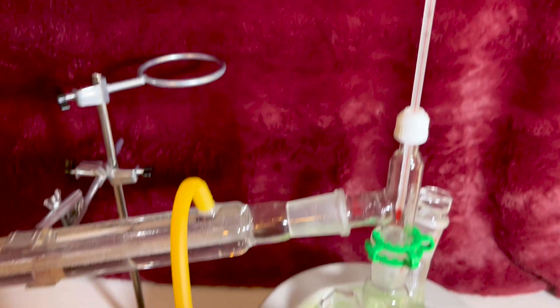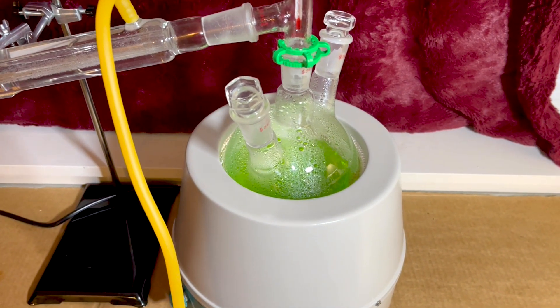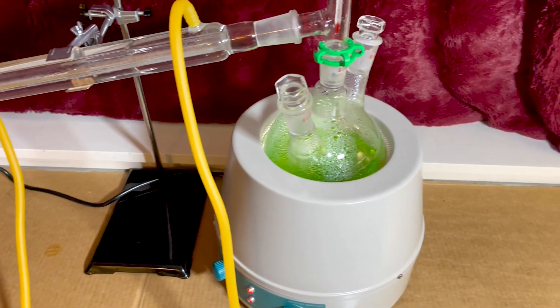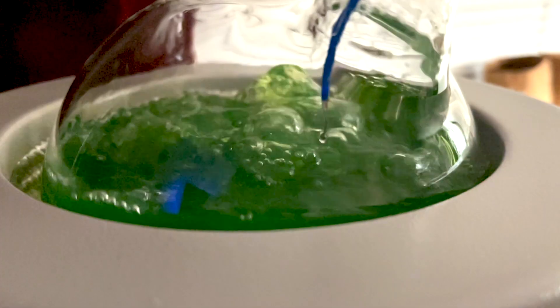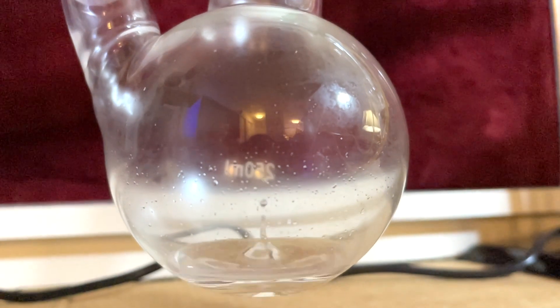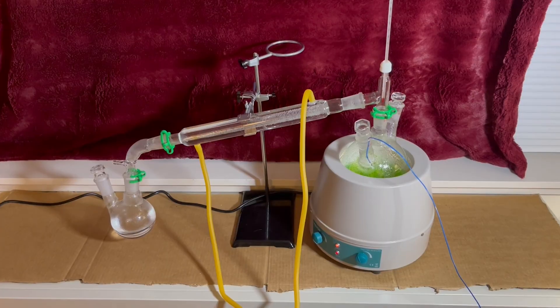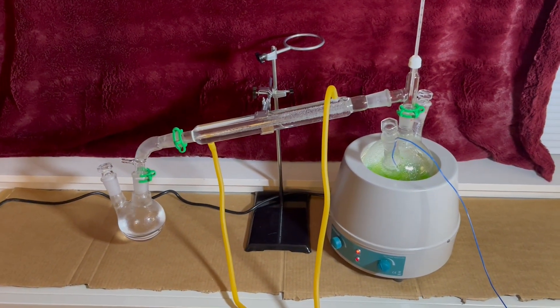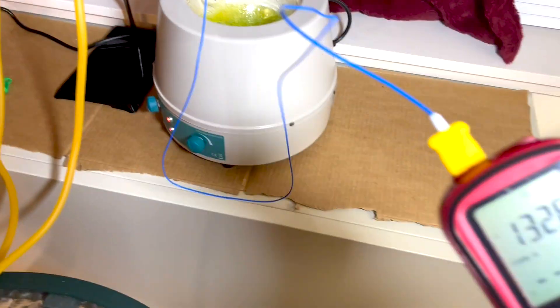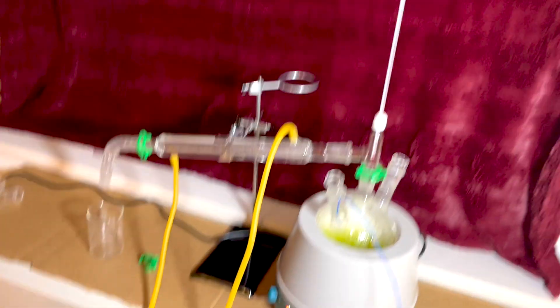So we're just starting to boil here, temperature is right around a hundred — this is probably the water fraction because it's diluted, so it's coming over pretty quickly though. Finally starting to come up in temperature, we're actually at about 145 on the thermometer; it just doesn't show up that well on the camera.